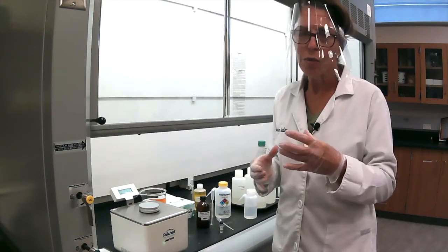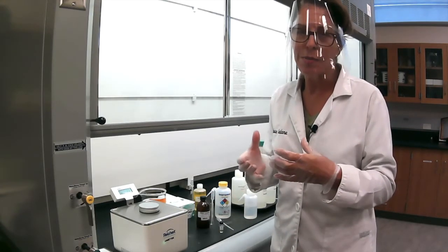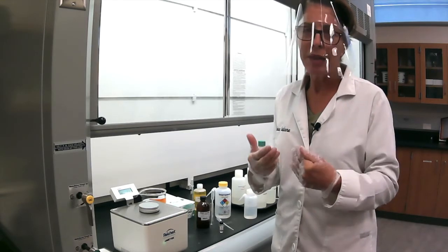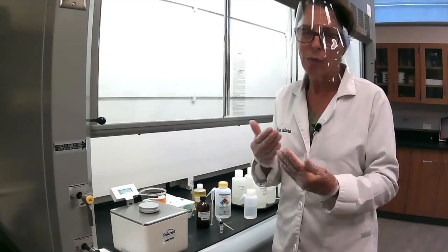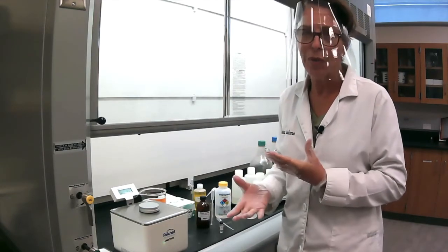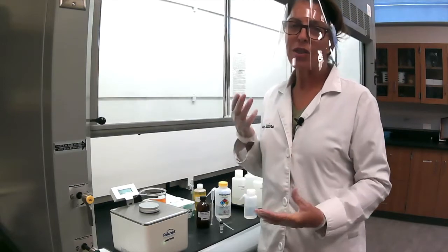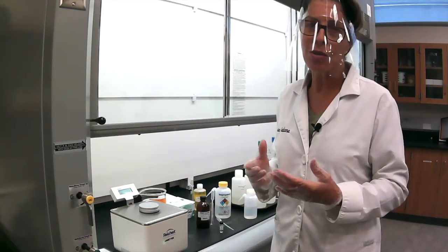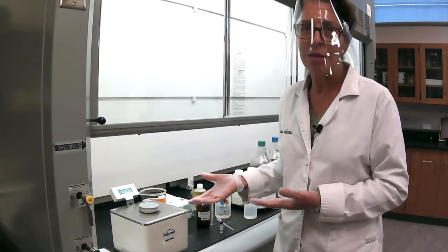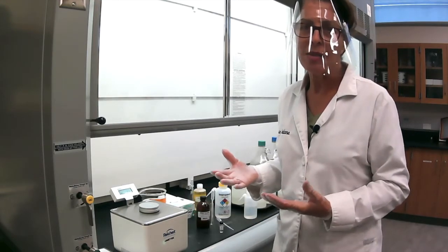But if it goes through a much lighter substance that is not dense, it will go through faster, and it will slow down, but not as much as going through a dense material. So in a way, the refraction index is correlated to density, but it's a very quick, simple and clean method to identify substances.